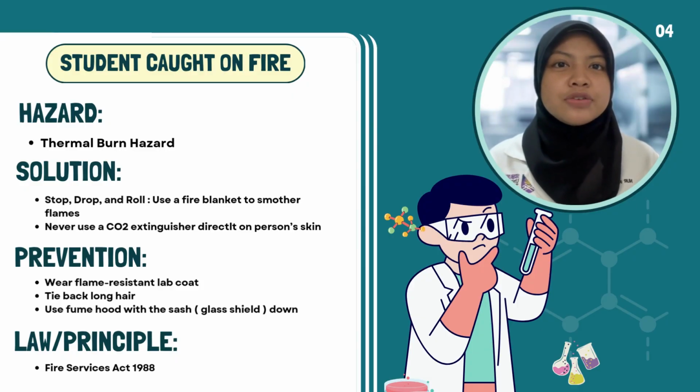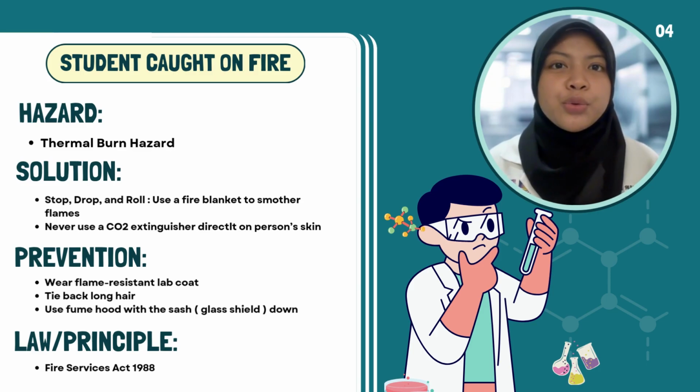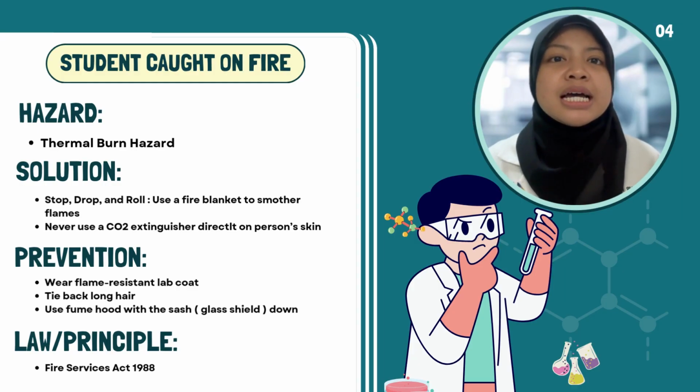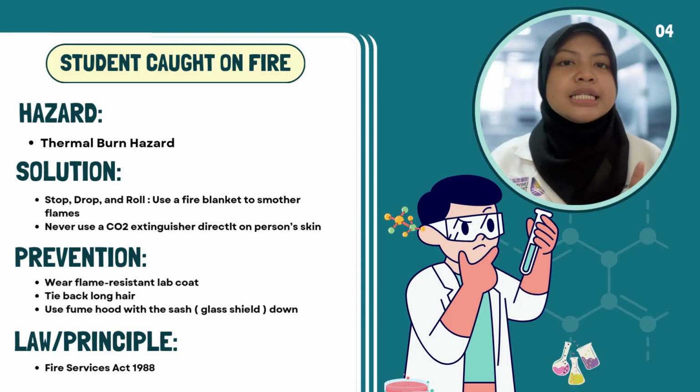As we can see in the video, the hazard involved in this situation is a thermal burn hazard. This incident can occur when a student wears loose clothing, leaves long hair untied, or works too close to flammable substances such as ethanol vapor during an experiment. In the video, the student catches fire.